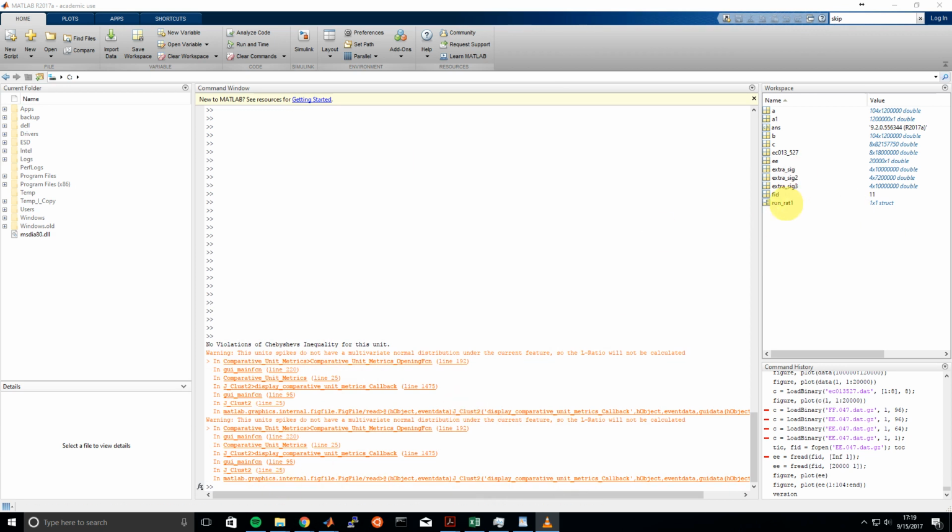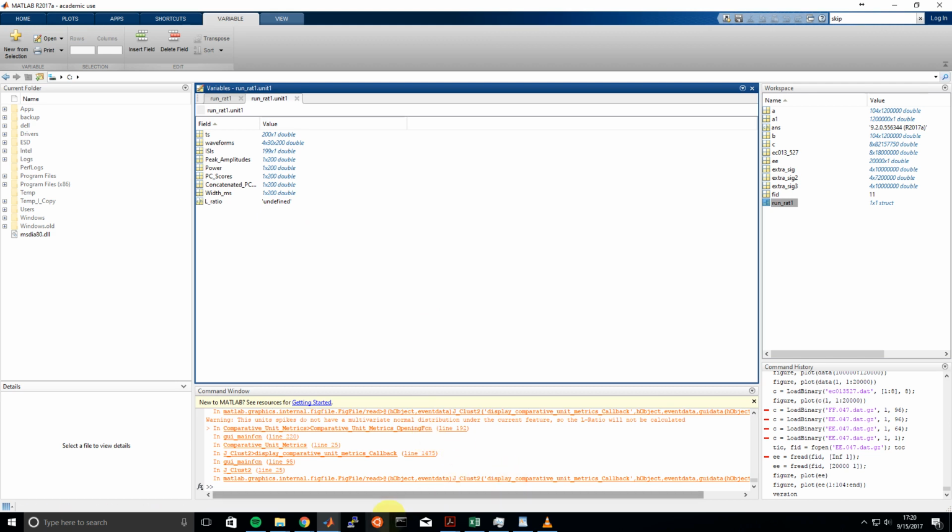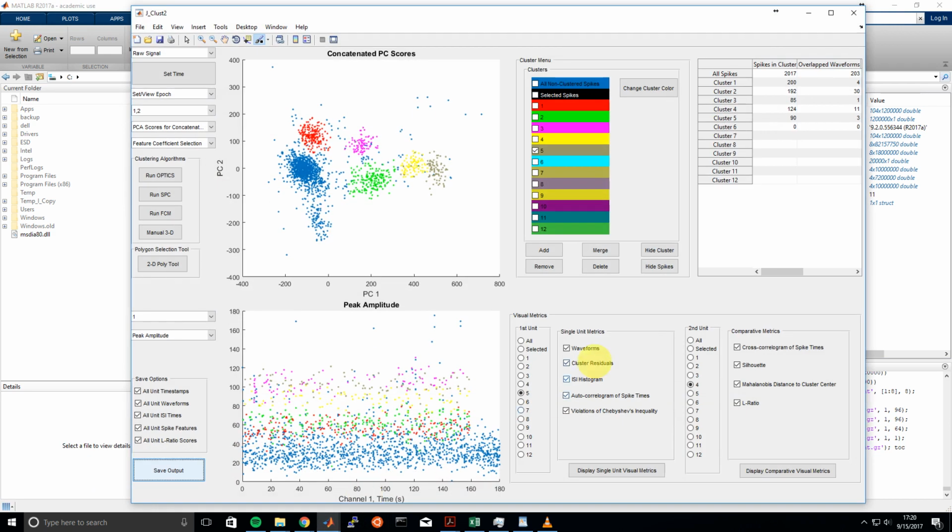And once you enter, you'll see that you get this variable stored in the workspace. This variable runrat1, maybe it was during a run session, so that's why we call it runrat1. It has every unit that we saved, and it has all the options that we wanted to save for that unit. So it has the spikes, the waveforms, the timestamps, all those features. And the L ratio here is undefined since this particular unit was not multivariate normally distributed. Okay, so that was a whirlwind tour through using the metrics in JClust2 and saving the output.